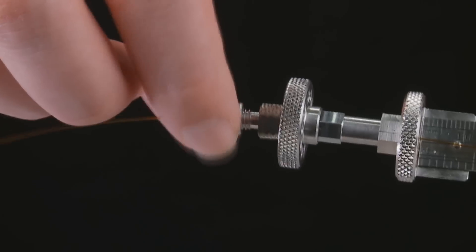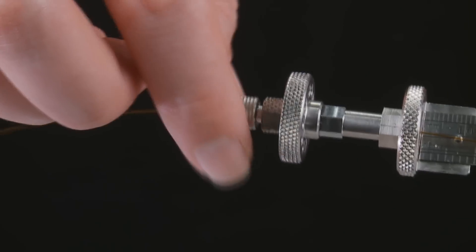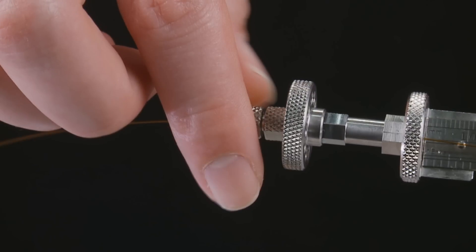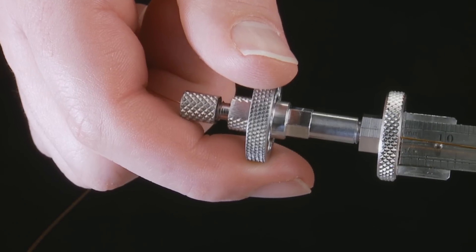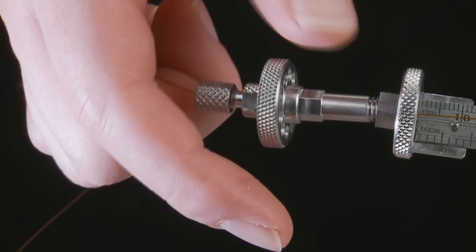Tighten the securing nut to the securing base, locking the column in place so it does not slide. Finally, unscrew the installation gauge. You are now ready to install the cool lock nut and column into your instrument.